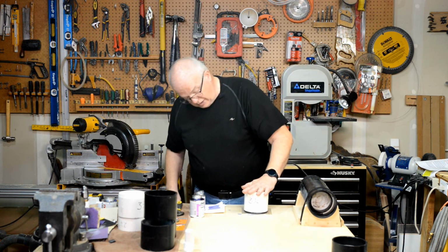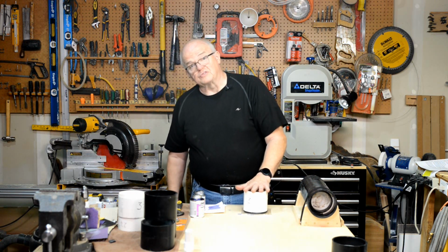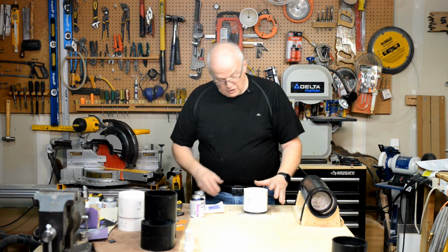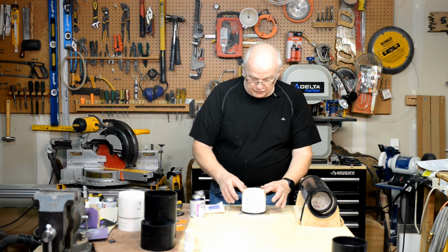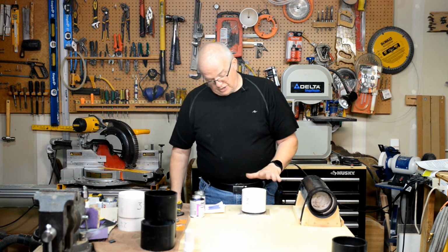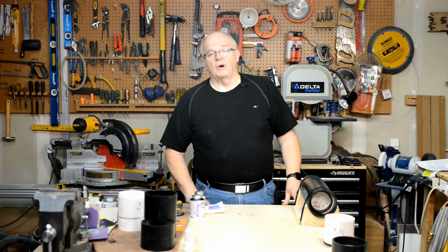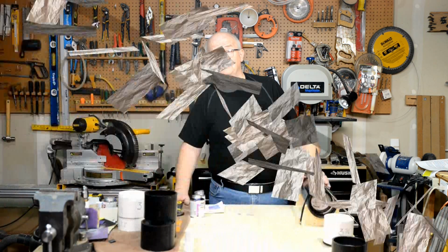Okay, now when you do that, do not force this sleeve down onto that O-ring. You just don't do it. You want it to just sit right on top of it. You want it to be nice and flat, okay? But do not force it down on top. You don't want to compress that O-ring, in other words, okay? After about a few seconds, we'll go ahead and we will slide that aside. Go ahead and pause the video here and get to that point and then come on back.